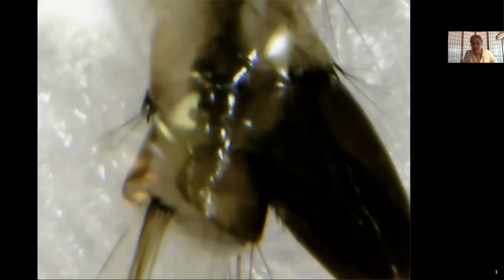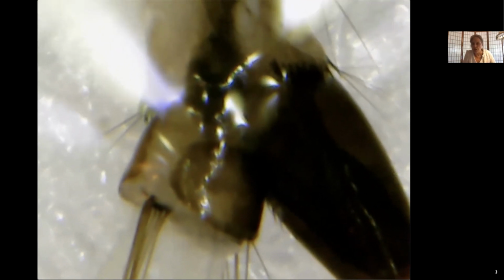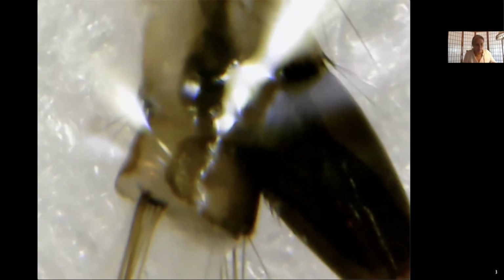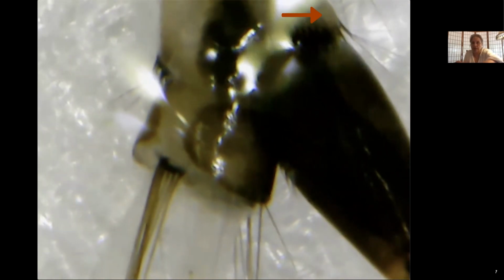All right. Okay, I was able to flip everything over, and now I'm able to show you the feature that we were looking for, which is the pecten. Now I want you to compare this with the hairs that you see. Do you see the hairs that are at the top of the siphon there? That is a tuft of hairs. You see over here, there's two setae, a couple hairs here.